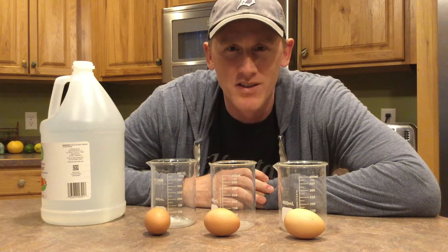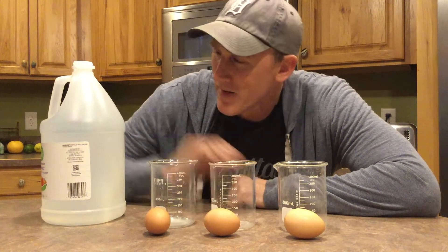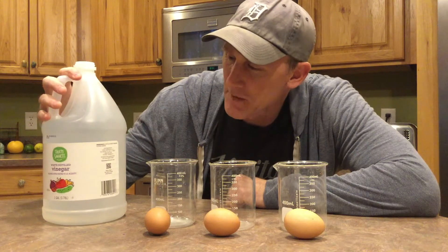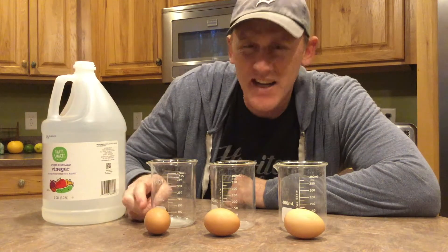Hello chemistry folks! We've got another lab here. We have vinegar — acetic acid — and we've been talking about acids. We also have eggs.